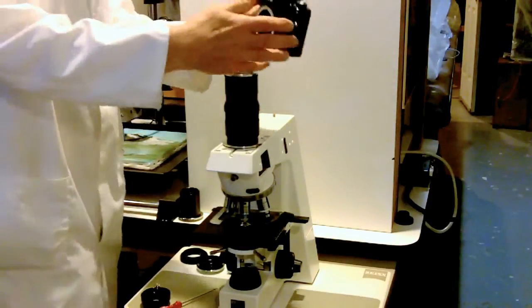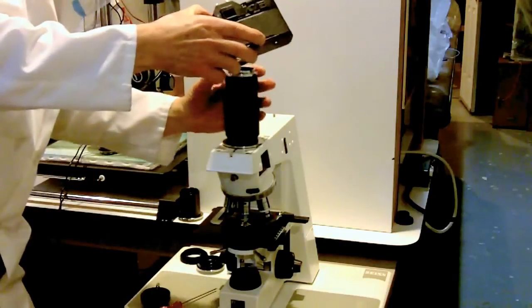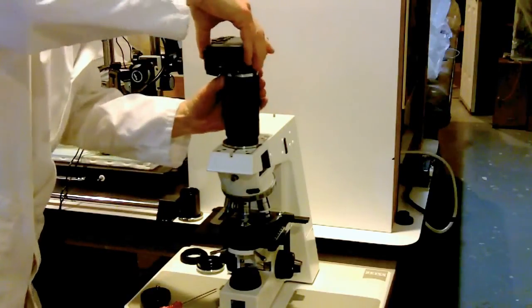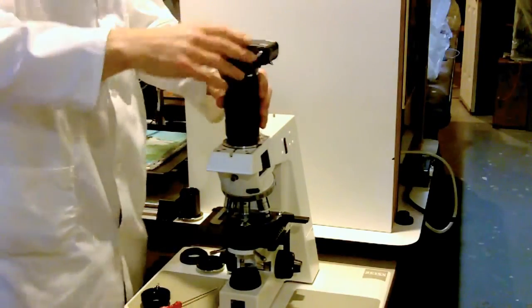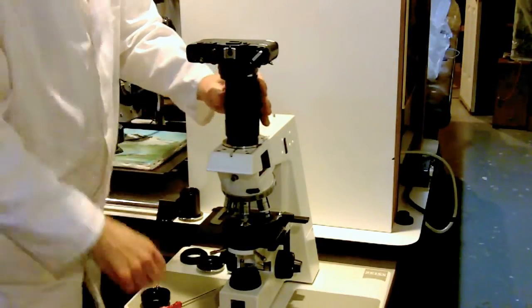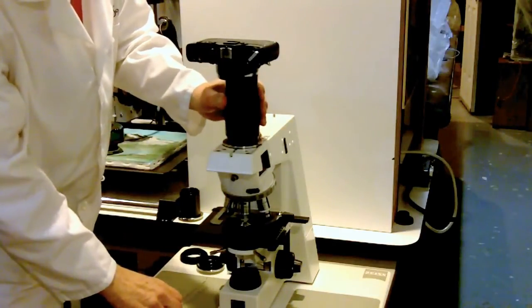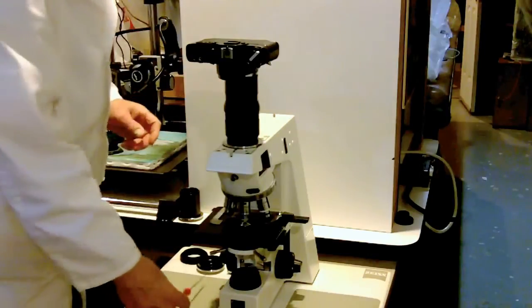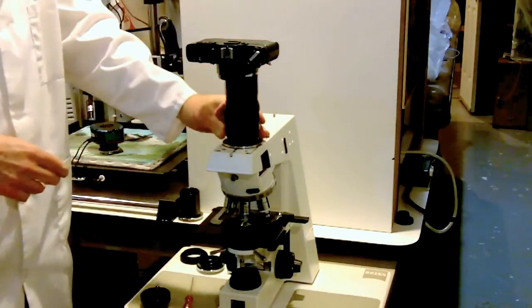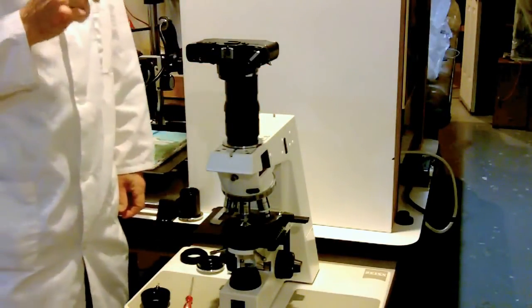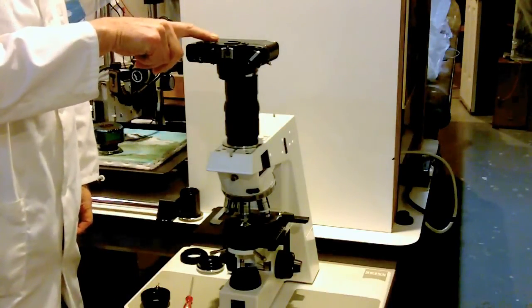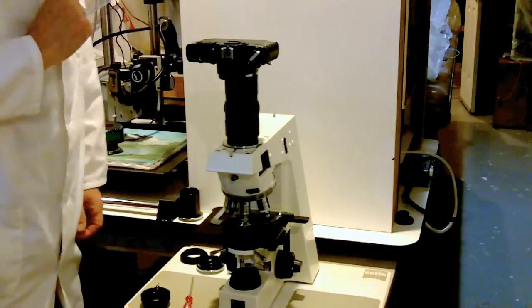Like so. We then get our camera body, look for the red dot to match up, bring it around and lock it in place. And now we've adapted a full frame 35mm film camera. But keep in mind that this could today be a DSLR or a MILC camera as well.